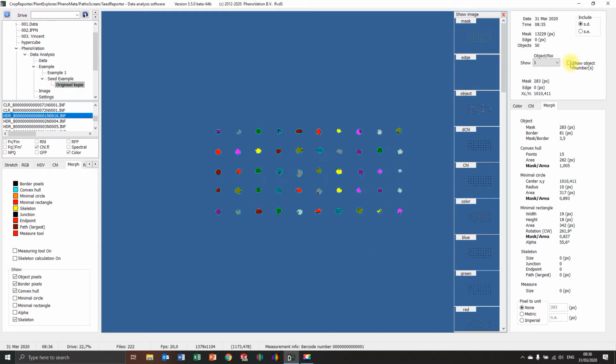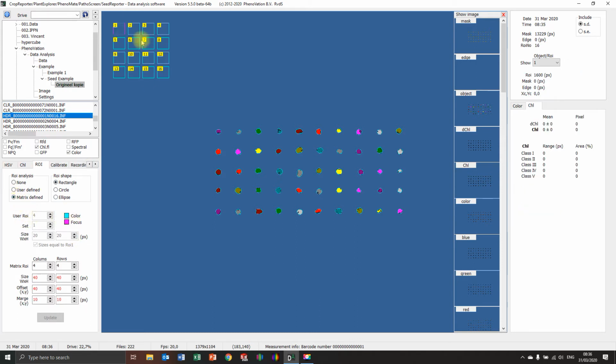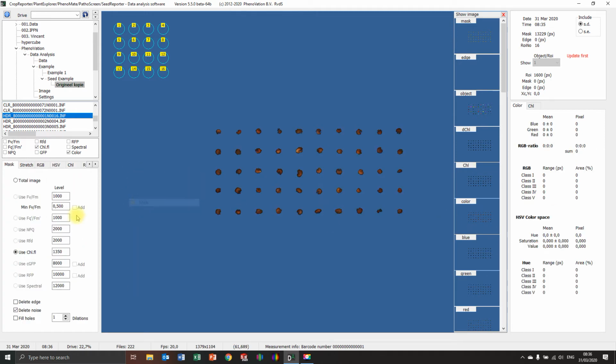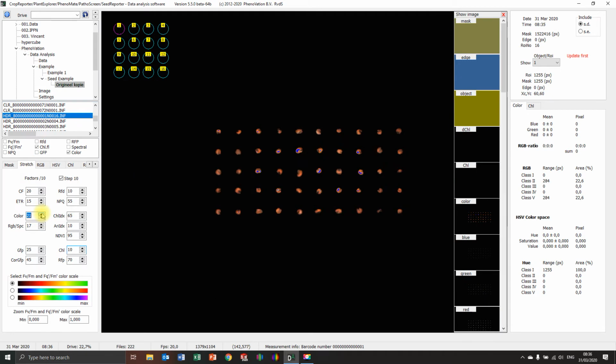But to solve that, to get the data out of the image, we're going to use ROIs, regions of interest. They are seeds, so I'm going to use circles. And to set the ROIs, I'm going to go to color, switch off the mask. I'm going to stretch the color image a little bit so I can see.